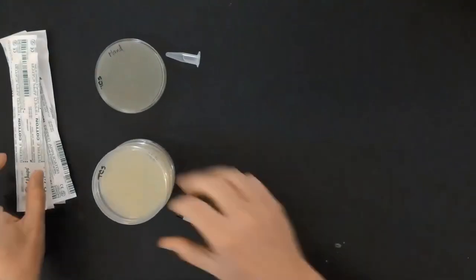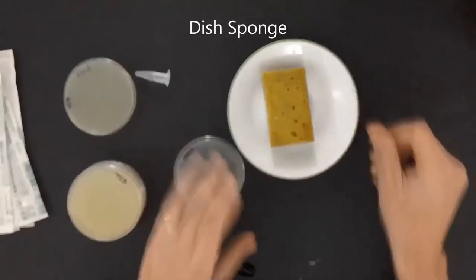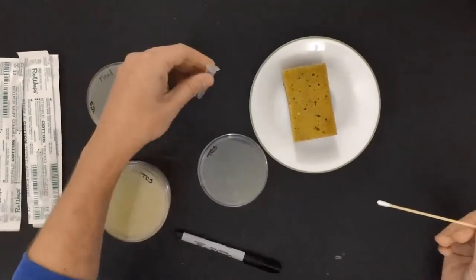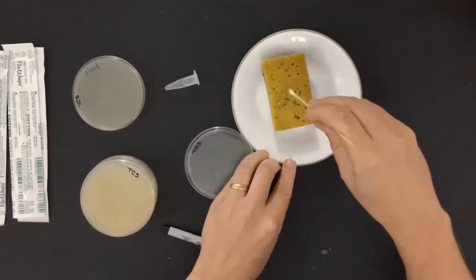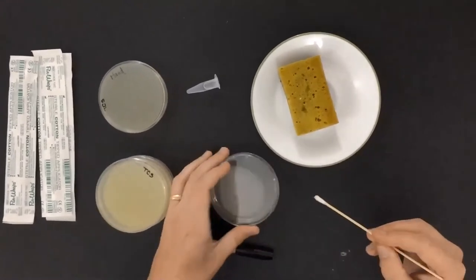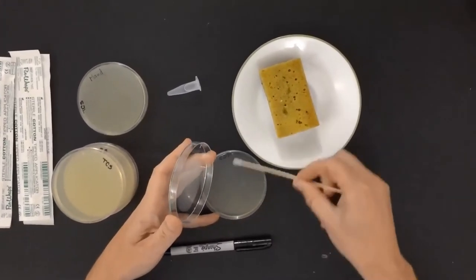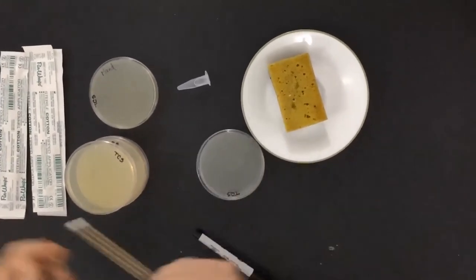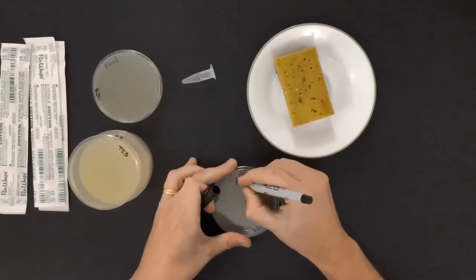The second thing I'm going to swab is a dish sponge. It's already wet so I don't need saline — I'll just squish it and smear it across the agar. There's the second one, labeled 'sponge.'